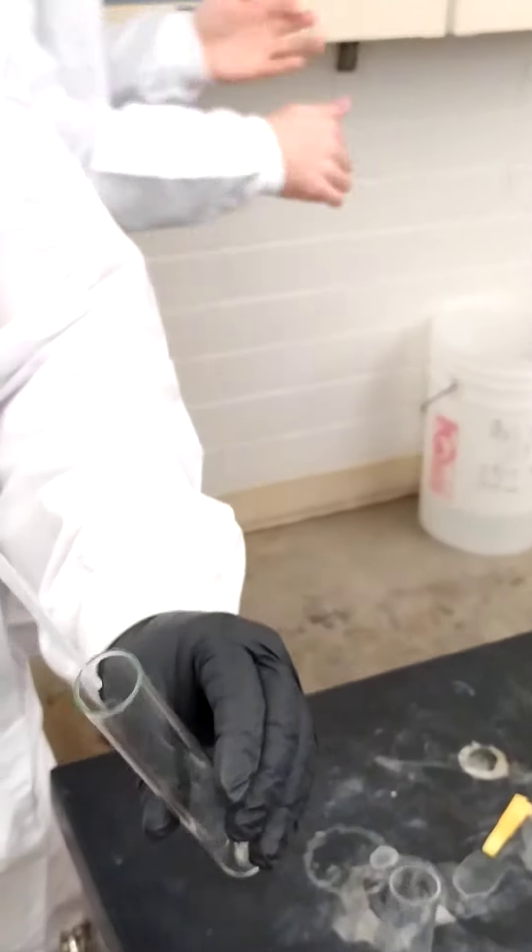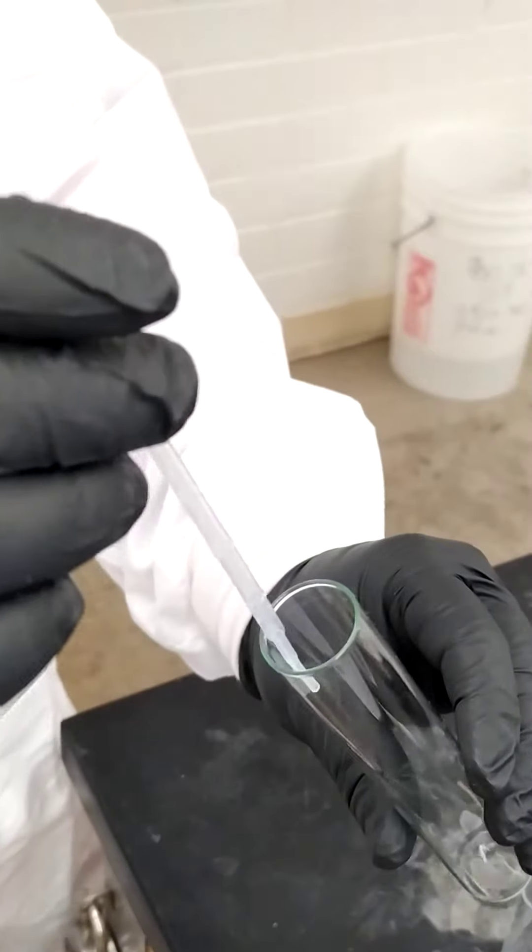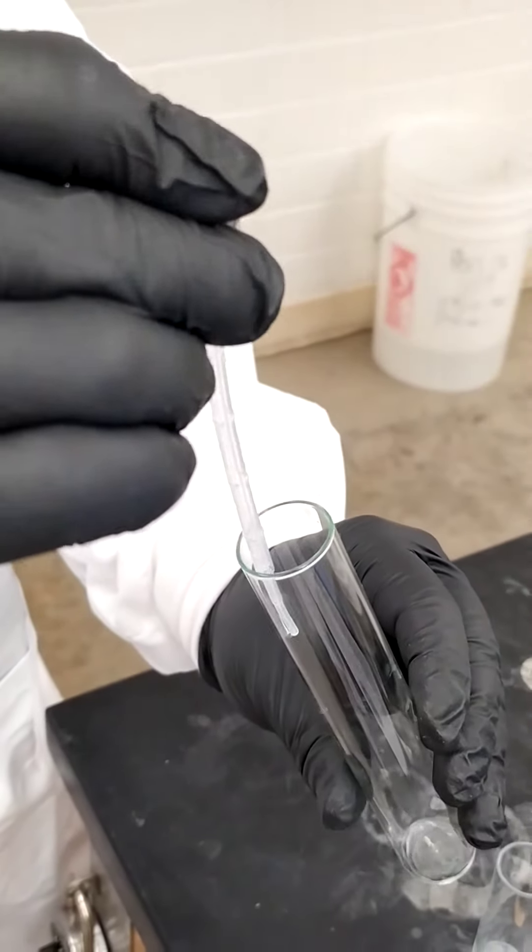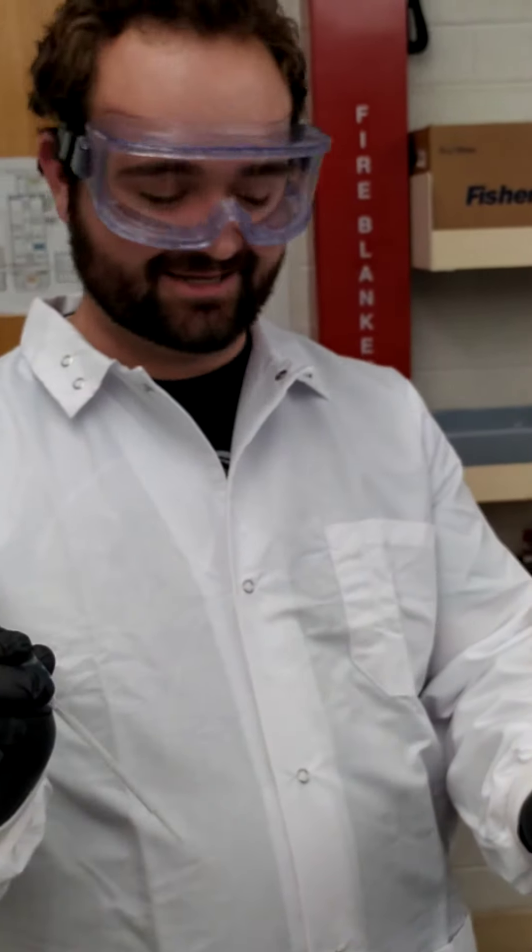When we put it into the new tube, make sure it's against the side and you're just going to squeeze it all out. And there we have it. Chemistry and science.